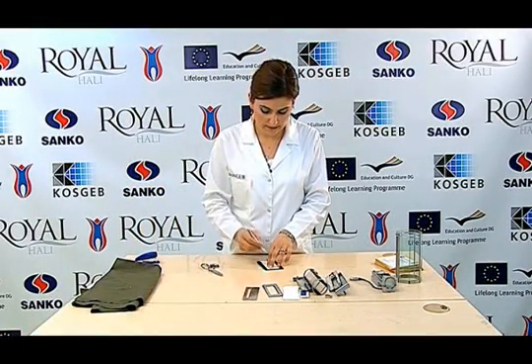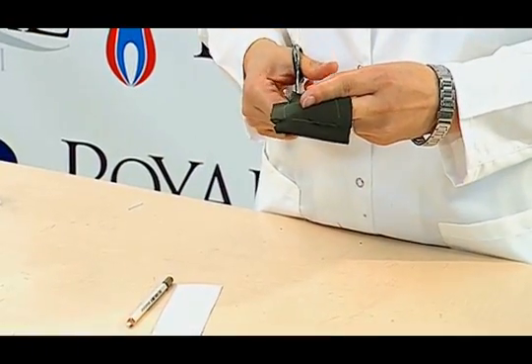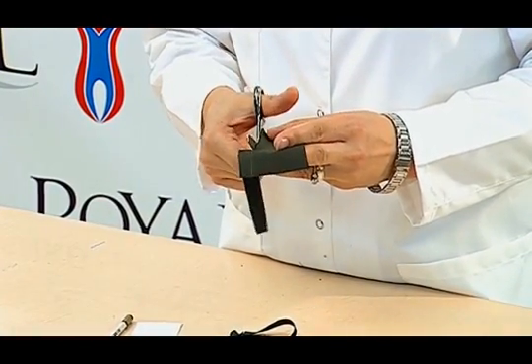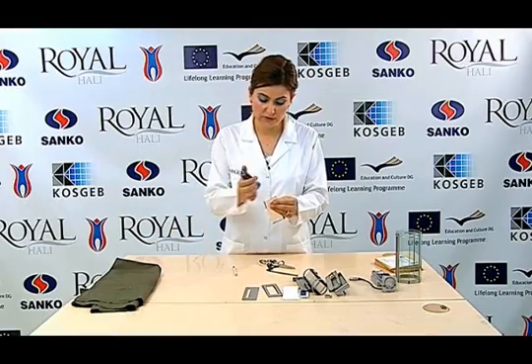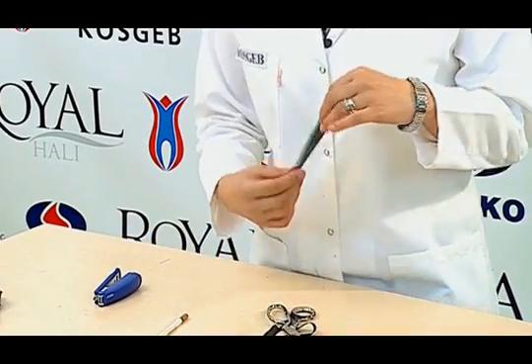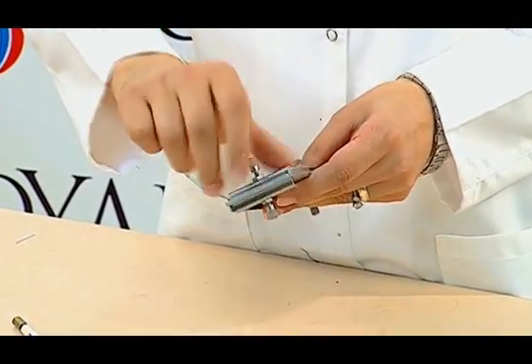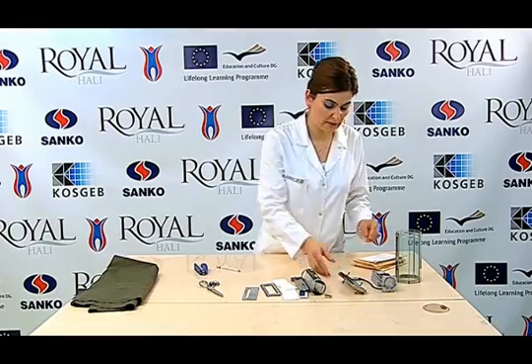We are using a certain size of 4.5 cm by 13 cm by placing the opaque cardboard on our test samples. Two samples are prepared in this way. The prepared sample is glued to the opaque cardboard or attached to it with a stapler. The prepared sample is placed in the sample holder, then attached with a mask so the part exposed to light remains open. The samples prepared in this way are for the blue reference samples.